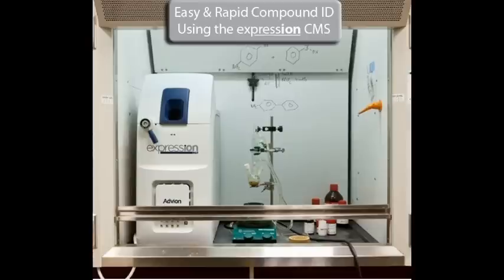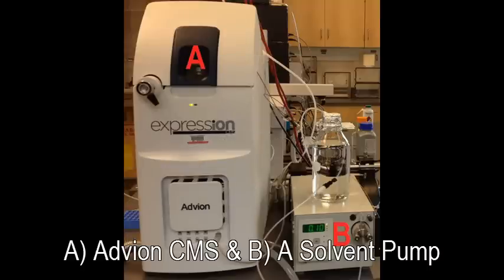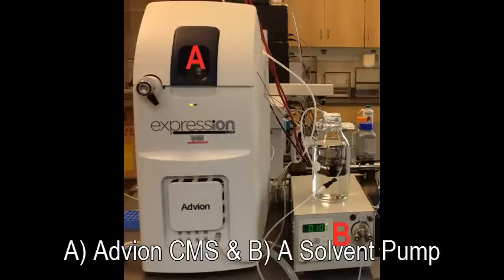Easy and Rapid Compound ID using the Expression Compact Mass Spectrometer. You will need the Expression CMS connected to a solvent pump.